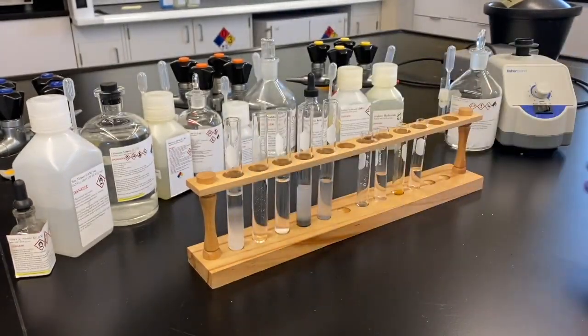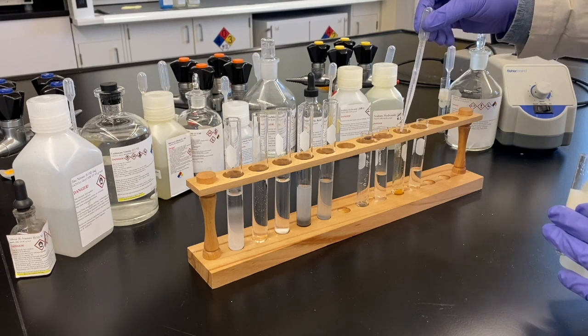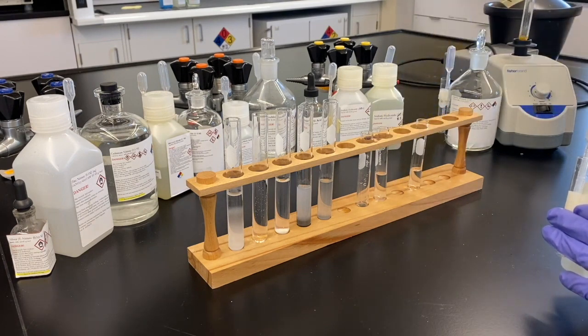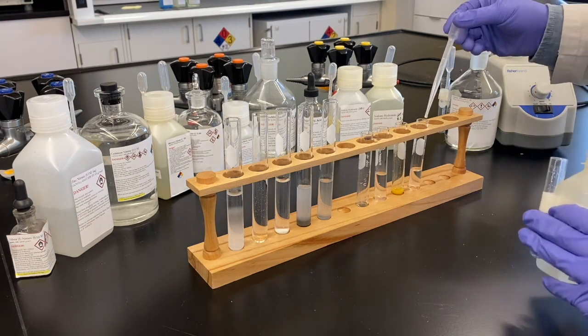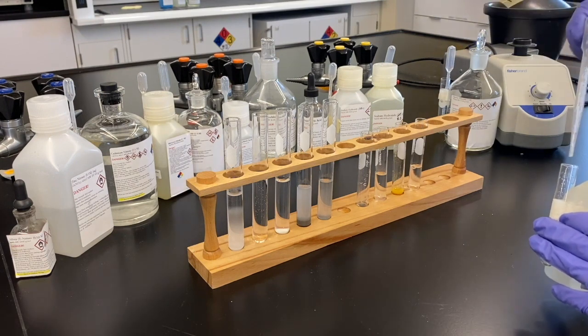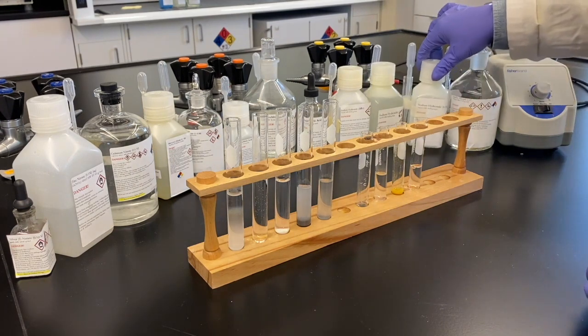So here we go. Just to be doubly cautious, we're going to test that mercury and potentially cadmium with additional sodium hydroxide for any amphoteric behavior. I don't think this was really necessary at this point because we added enough base in the first step, and the amphoteric species should be in the supernate on the right there, if there was an amphoteric species present. In fact, we tested that off screen, and there was no amphoteric species. So zinc is not actually present in that test tube. It's just a supernate of various spectator ions.